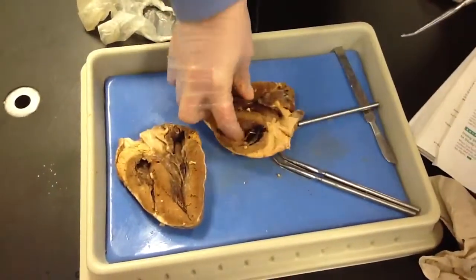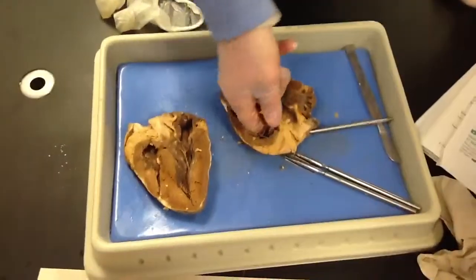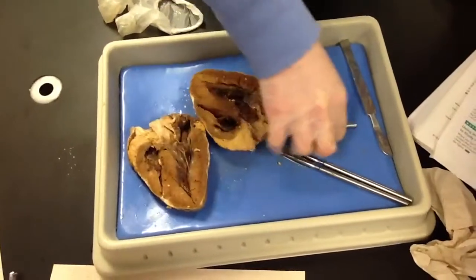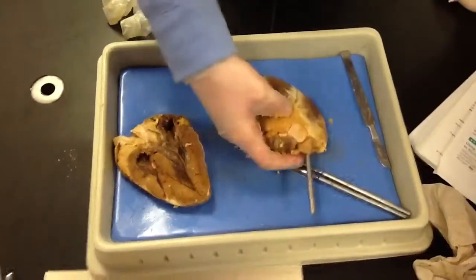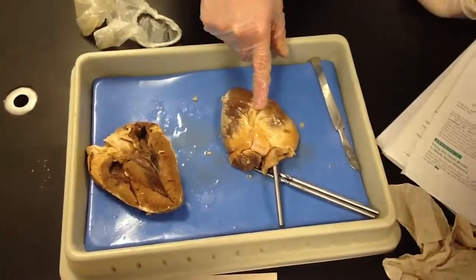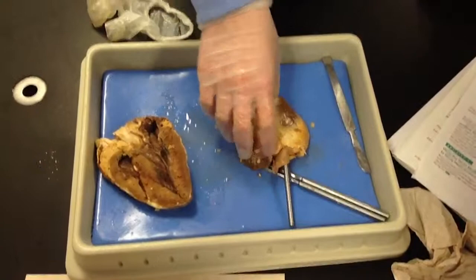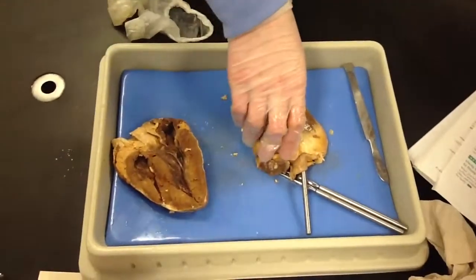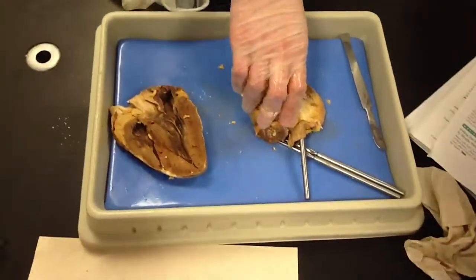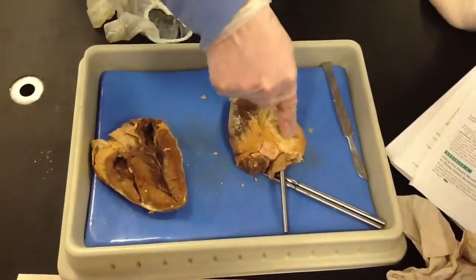So we're talking about the pulmonary artery, right? So once again, we're following it through out to the artery. Now, what is this then? That was the posterior, so this is the anterior. It's the exact same thing, but one side's the front, one side's the back. So what does anterior mean? Anterior means front, posterior means back. It's super easy as long as you find your blood vessels.